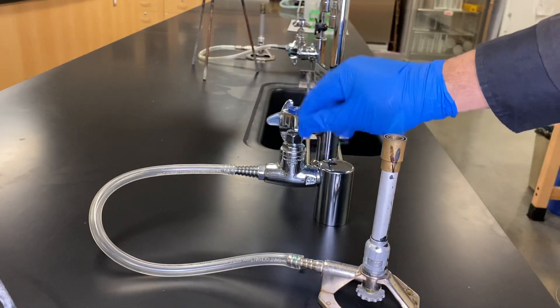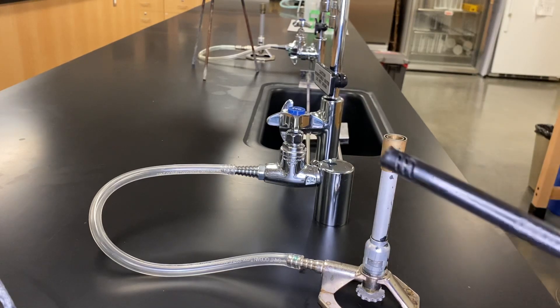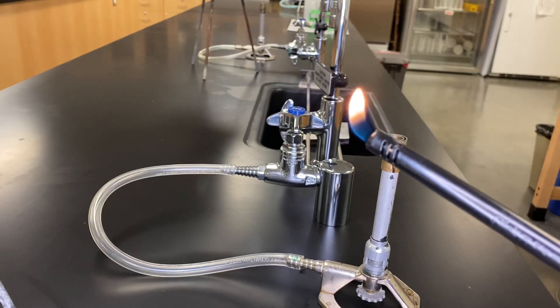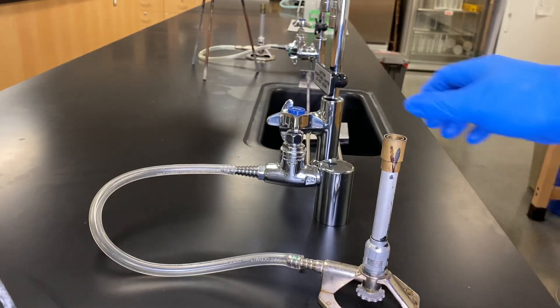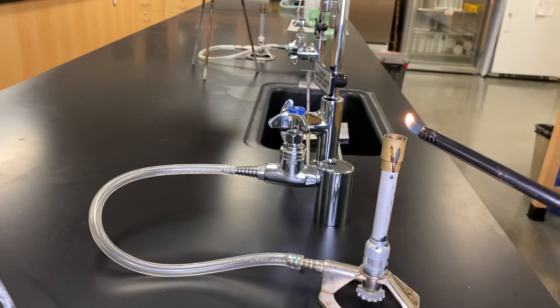So we're going to close it up really quick. And you'll notice that it's gone. I'm going to try this again, just for the sake of it. So you want to get some good practice with using your wand lighter too. Sometimes it doesn't go on the first time. So we open it up. You can hear the gas flowing. And then do this from a distance and then touch it.